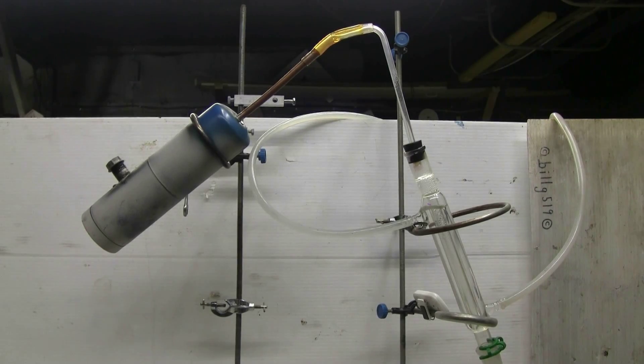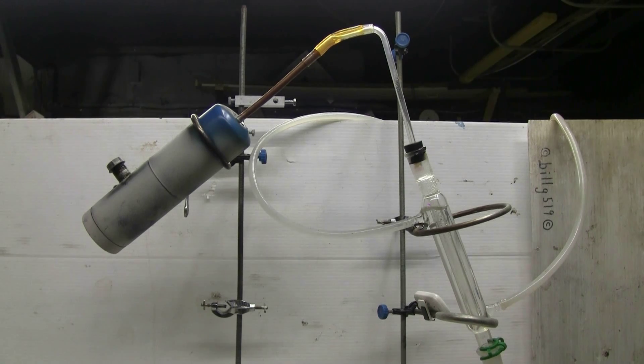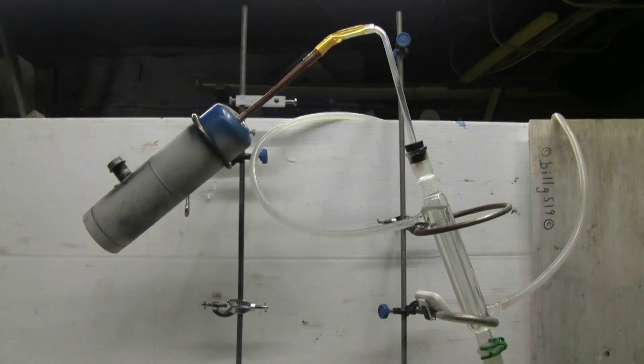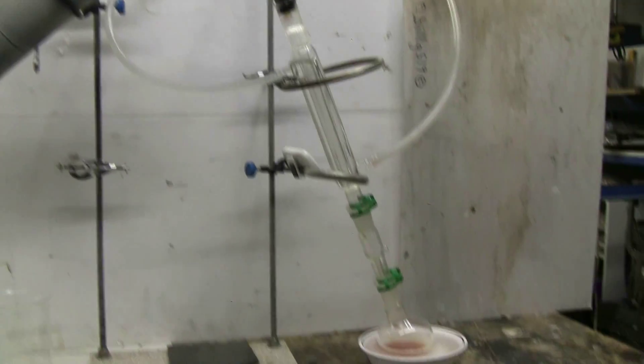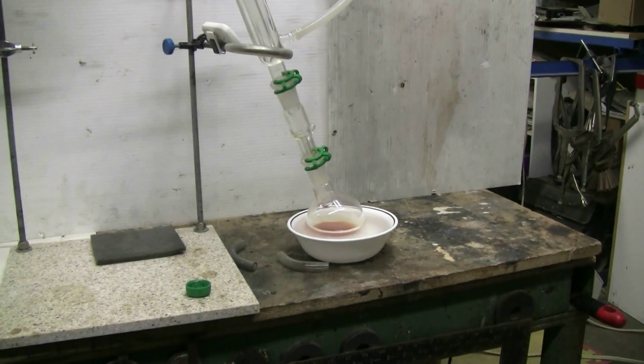I was finally getting very little to no more benzene being evolved from the reaction vessel despite the high heat applied to it. So I've stopped the process. I have a little over 100 milliliters of very impure benzene.